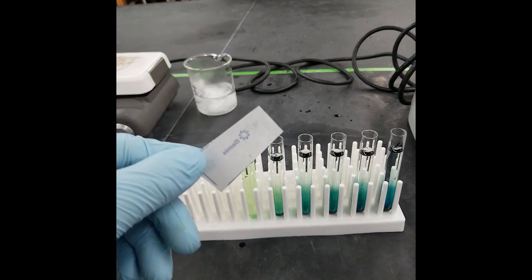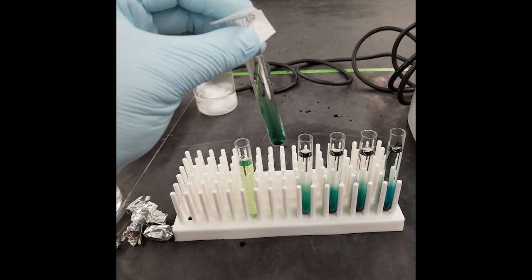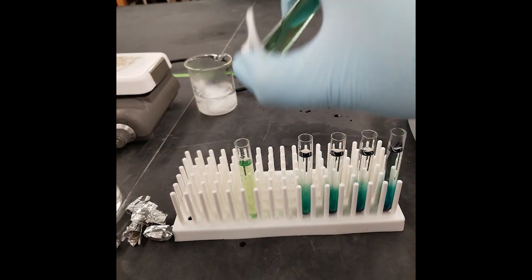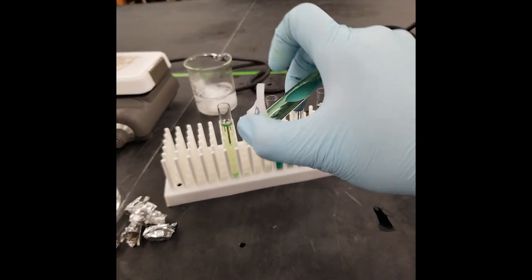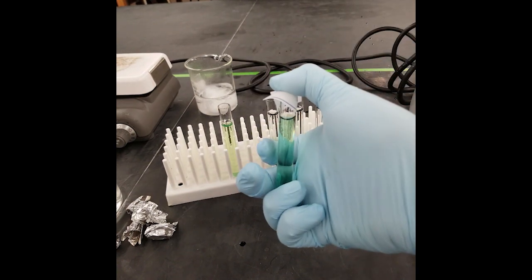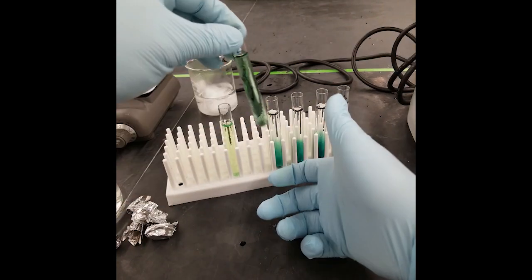Here I'm not showing the addition of water in this demonstration, but after adding the five milliliters of water, mix your samples by taking a piece of parafilm, placing it on the top of the tube and securing with your thumb, and gently invert four to five times. Let your tube stand for a minimum of 30 minutes for the final incubation step, and use your bench top spectrophotometer to read the absorbance of your samples.